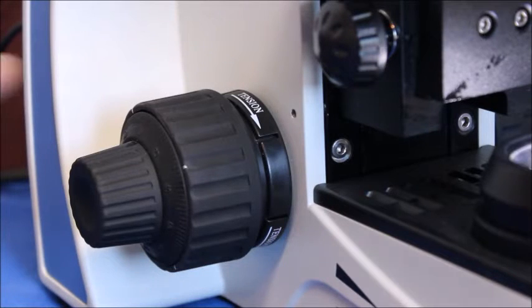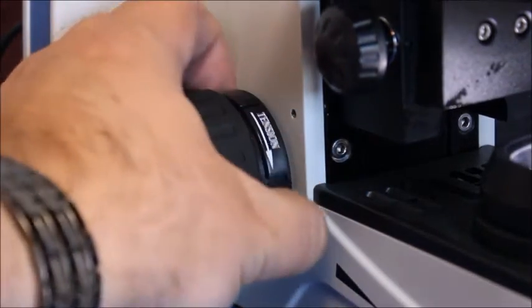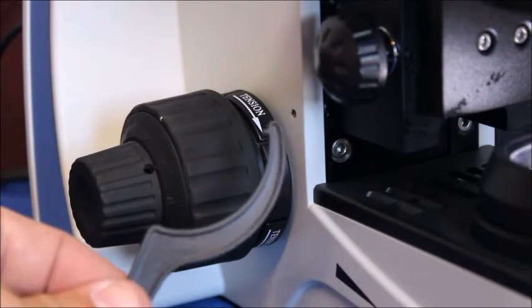This microscope is kind of convenient because it's labeled right here it says tension. Now you can try to adjust it with your hands or if that's a little too difficult a lot of times they'll come with a tool.